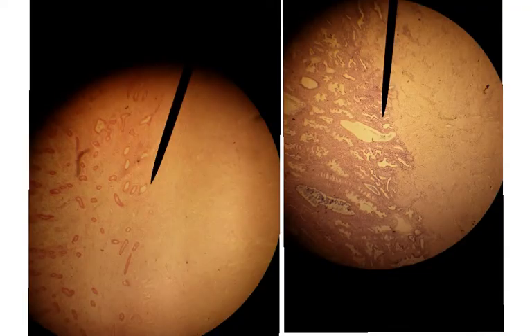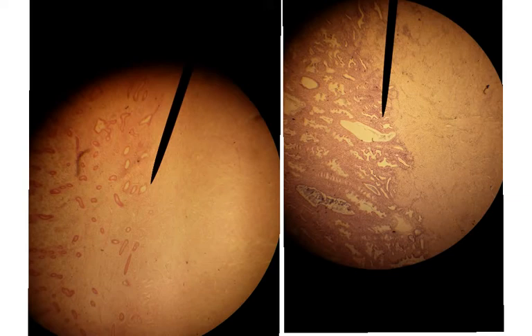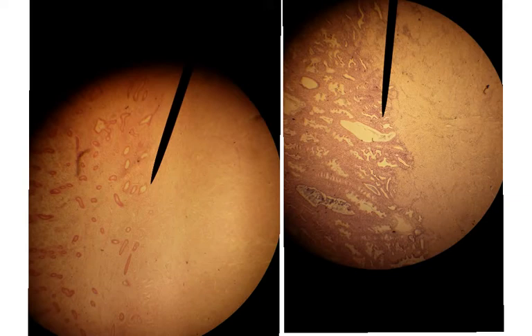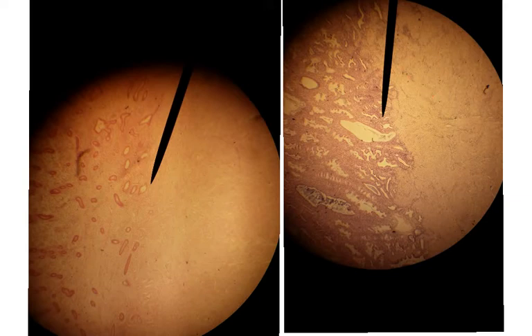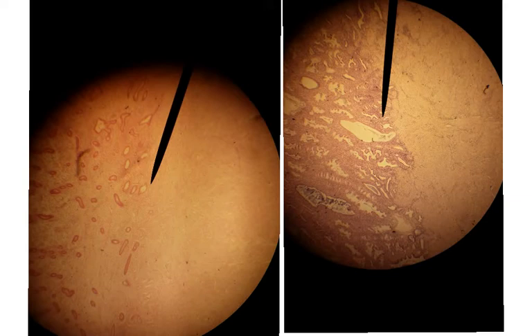Now moving to females — these are two uterus slides at different parts of the month. This first slide on the left is called the proliferative phase, which covers days 5 through 14 of the menstrual cycle. On the right is the secretory phase, which is days 15 through 28 of the cycle. There is a menstrual phase, days 1 through 5, but that's not a slide you're responsible for knowing.